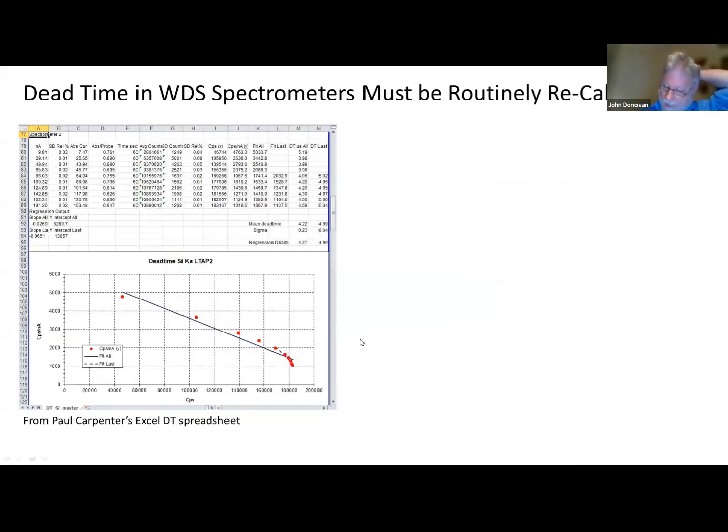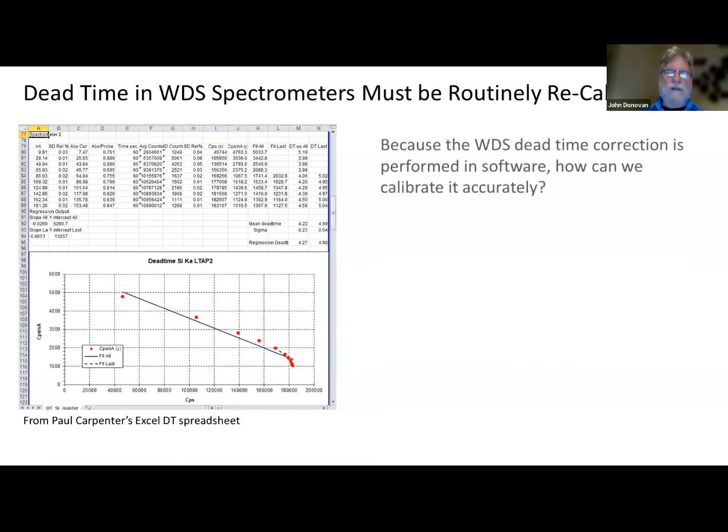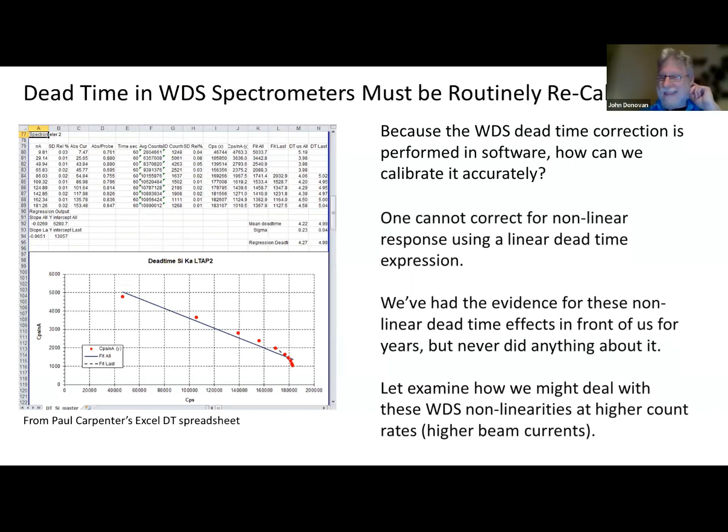So let's change topics here. Switch, something completely different. We have calibrated our dead time since I started in the field by acquiring a plot of count rate versus beam current. And we look at the slope of the line we get, and we try to apply a correction for that. And it assumes a linear model. But this is no longer working. As you can see, even in this older plot here, you can see it going nonlinear here at the end. So something's going on here.